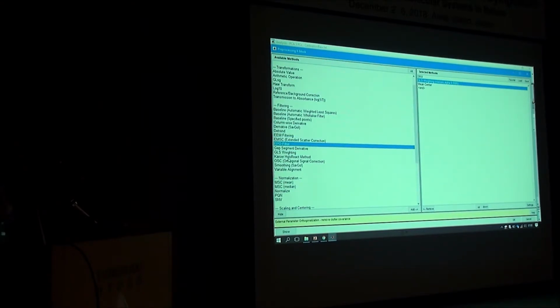I tried EMSC as well for the composition, but I got better results from GLSW. So you generally would recommend always GLS? For this type, it is fine-tunable, so you can change it slightly and see how it affects the result. With EPO or EMSC, you suddenly remove one dimension completely, and maybe the solution is somewhere in between.